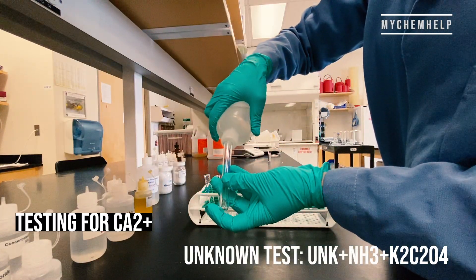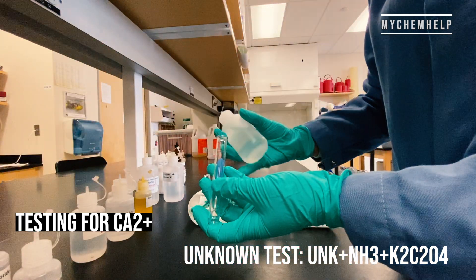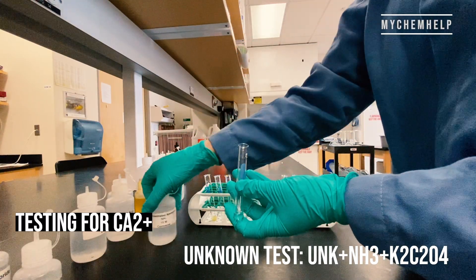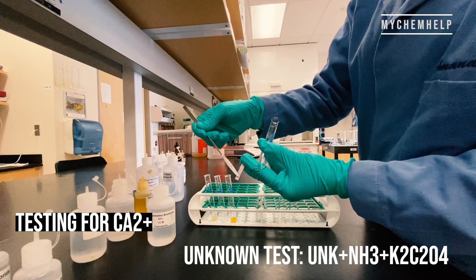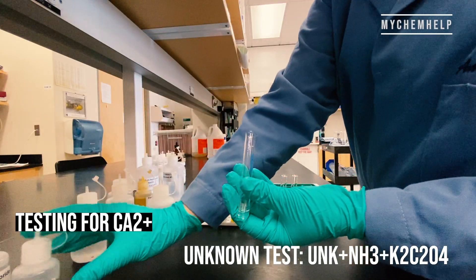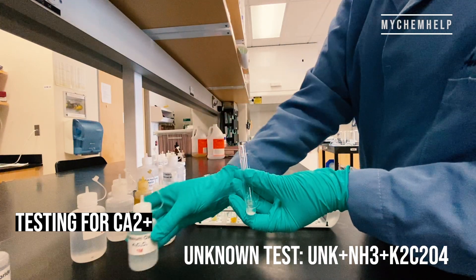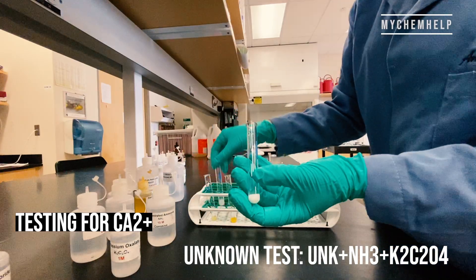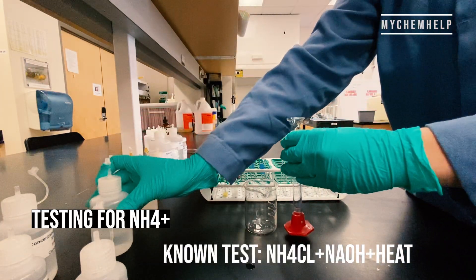So now we're testing the unknown. Our unknown solution is followed by ammonia, and again I'm going to test to make sure that it's basic, then a few drops of potassium oxalate. I'll let you guys come to your own conclusions about these unknowns — maybe if you want to follow along and write down observations, you could find out what the unknown is or hypothesize about what you think it is.